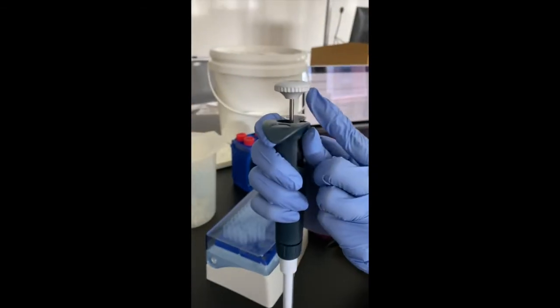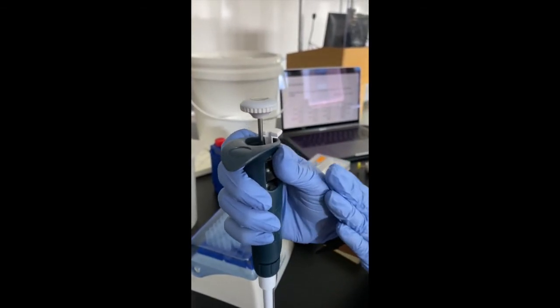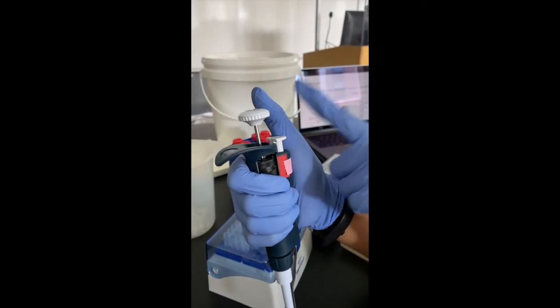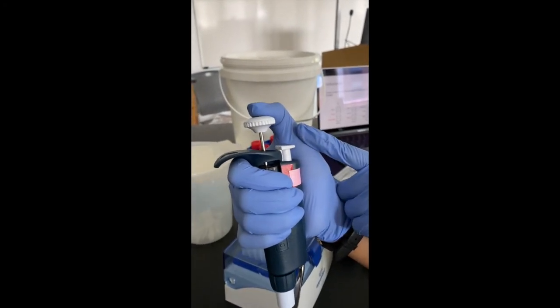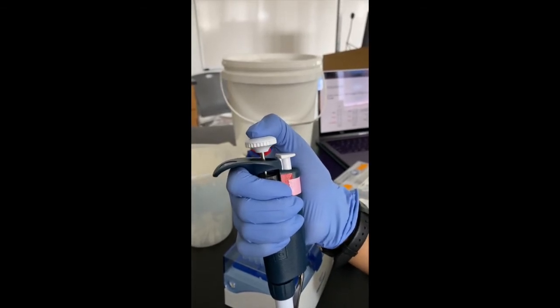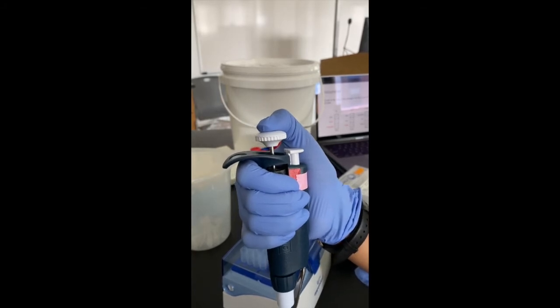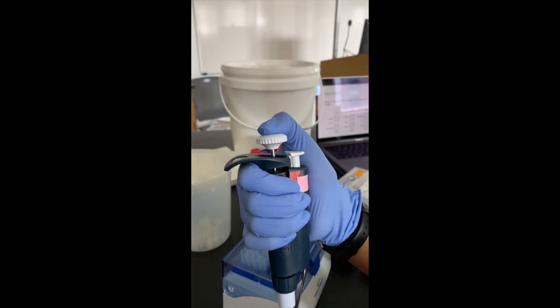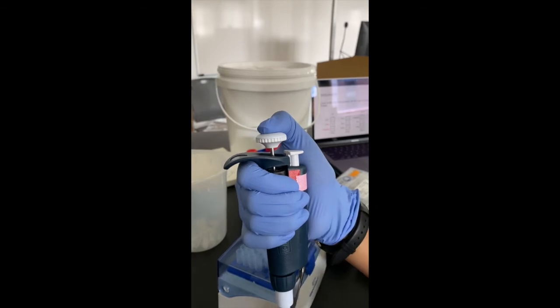So this is the plunger for a micropipette. The state at which it is currently in is called the state of rest. Once you place the micropipette into your palm, you use your thumb to manipulate the plunger. So you apply slight pressure on the plunger, and you can push the plunger in, and by doing so, you will notice that you encounter a first set of resistance. This state of the plunger is called the first stop. You cannot move the plunger further down without changing the amount of pressure. So you have to increase the pressure in order to push it down further.